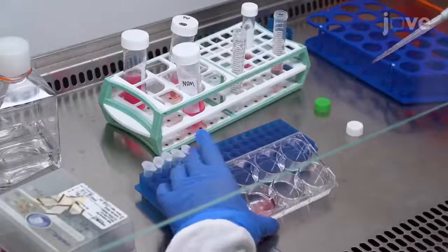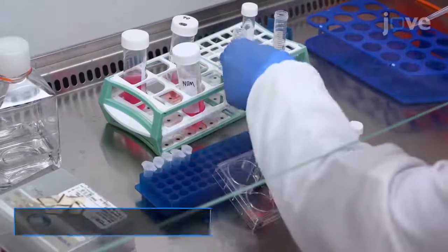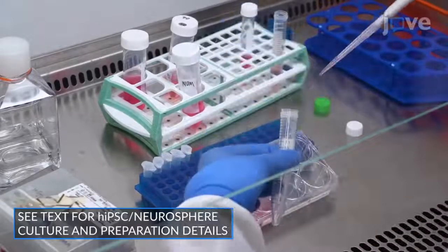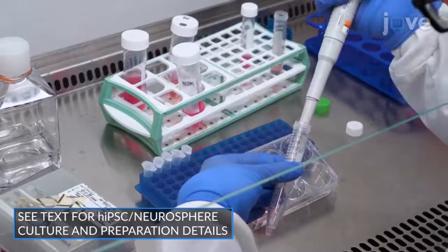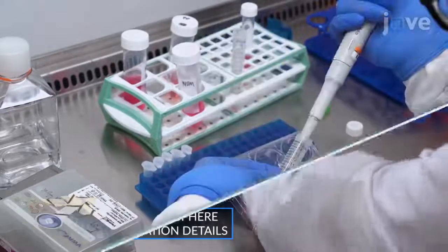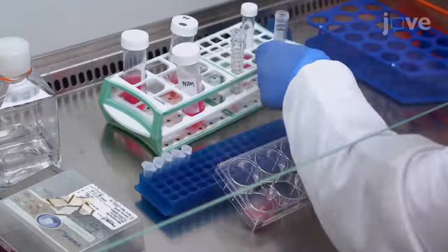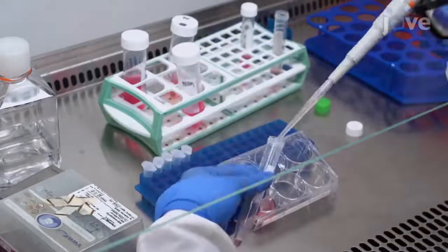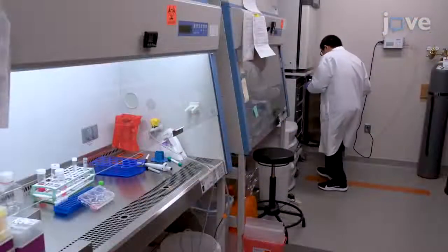After day 35 of culture, dissociate the neurospheres differentiated from human-induced pluripotent stem cells into small clusters with one milligram per milliliter of cell detachment solution for two minutes at 37 degrees Celsius.